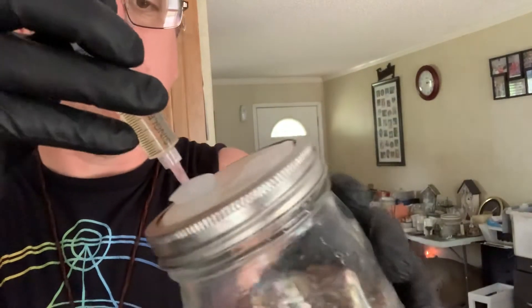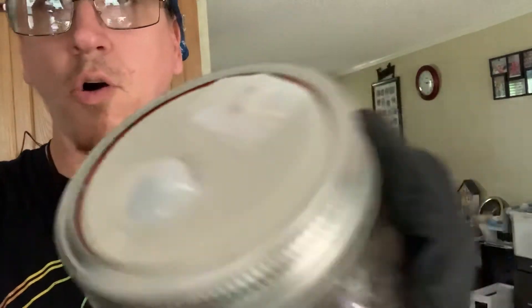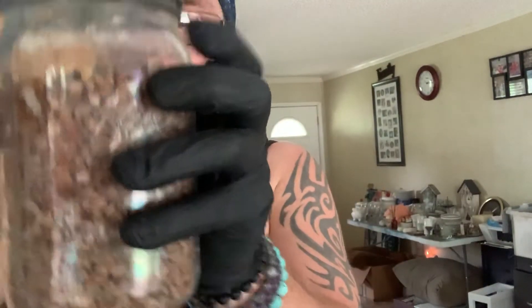Make sure you always always wipe everything off. Wipe the needle, spray down, then go back in — see the hole right there, go right in on one side, then the other side, and take it out. Keep on shaking the syringe between injections. I still have a few red-top jars in circulation — my first round I made red RTV tops, then I was told about clear, tried it out, and I like it. So I am slowly converting over to all clear.